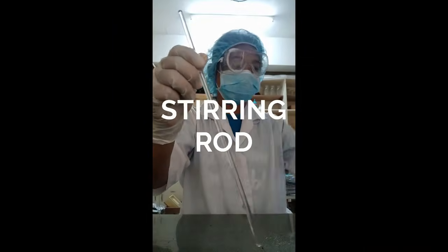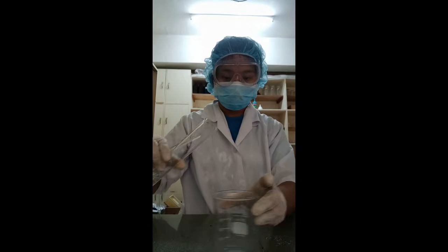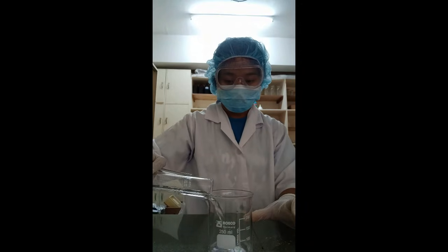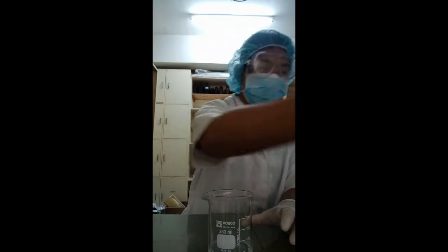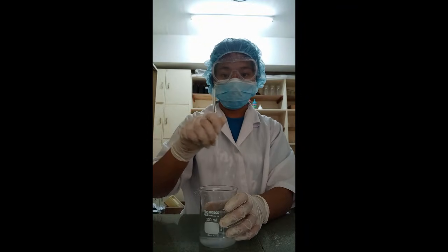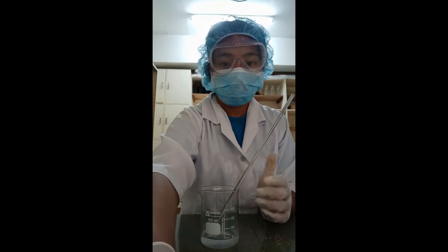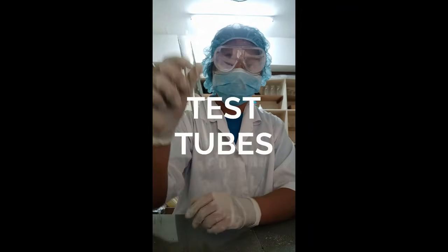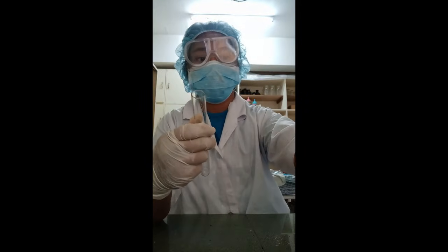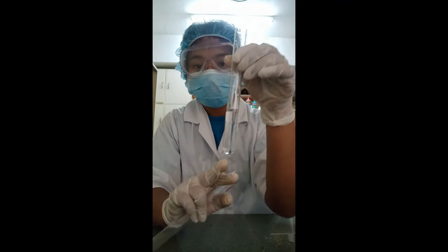Stirring rod. It is a piece of laboratory equipment used to mix chemicals and liquids. They are usually made of solid glass, slightly longer than a drinking straw, with rounded ends. Test tubes. It is a glass tube with one end open and the other end closed. It holds small samples and is used for qualitative assessment and comparison.